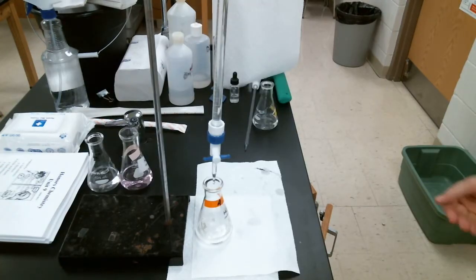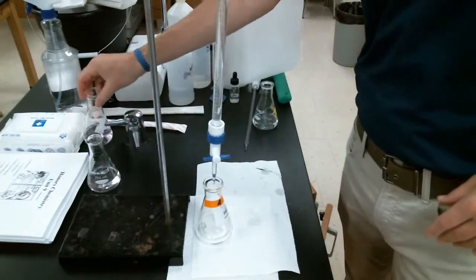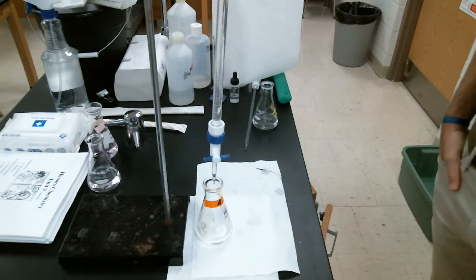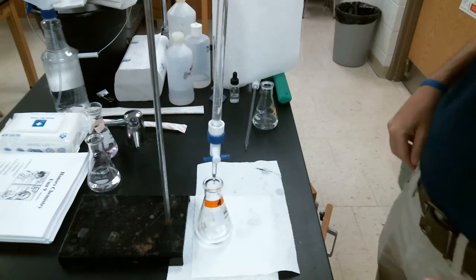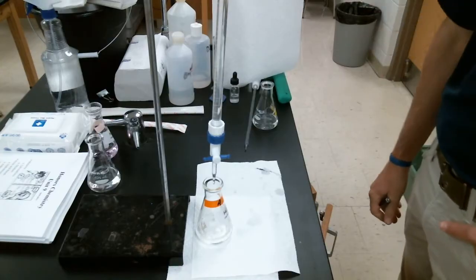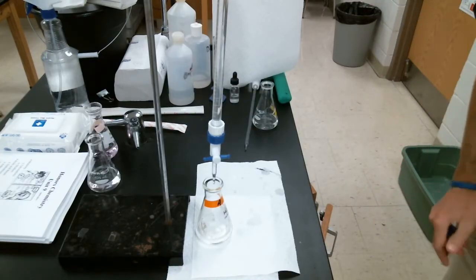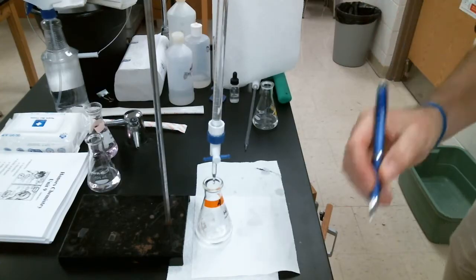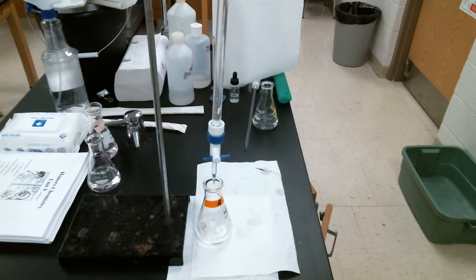All right, I have trial 2 set. And again, let's just watch this. So trial 2, my starting volume. Again, it's going to be hard for you to see at home. I'll just tell it to you, but make sure you copy this down. It is 4.40 milliliters for trial 2.